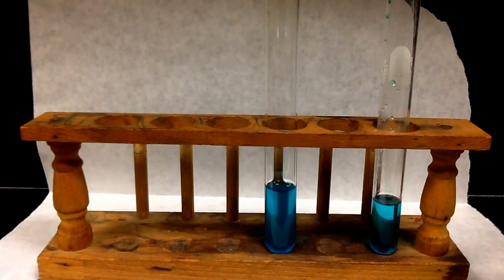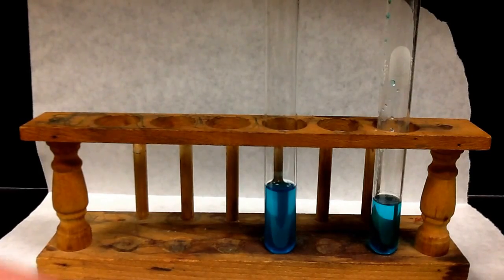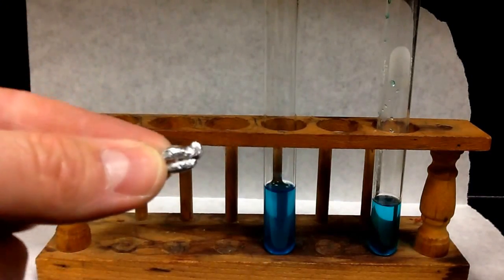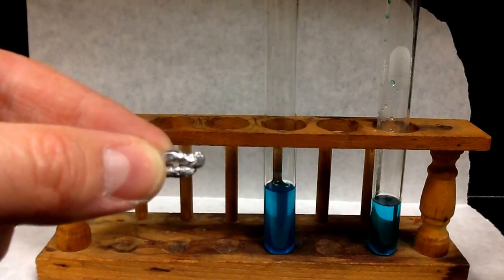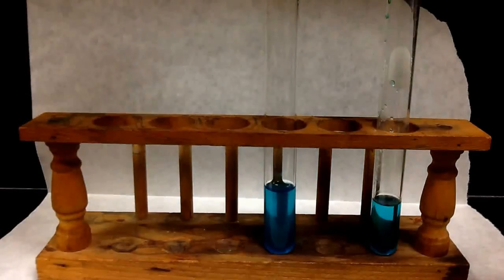So I'm going to take a piece of aluminum, and the aluminum looks like this. This is the piece of aluminum we had. You could use aluminum foil as well. I'm just going to drop this in.